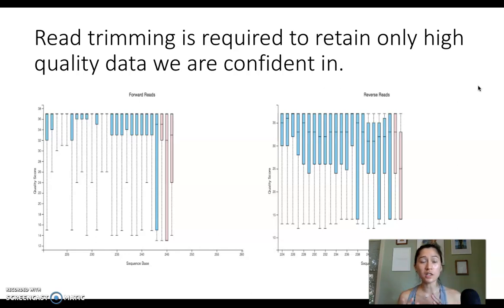When we are looking at our sequencing reads, at this point, we're using every single read we've obtained for our data analysis. But really what the quality plots are telling us is that even though the sequencer gave us nucleotides for every one of those 250 base pair positions, the nucleotides that it gave us at the end of the read, it's not very confident in. A lower quality score means we're less confident that the nucleotide that was assigned is actually the real nucleotide that was present in the sample. That's why we have to do this trimming step. We only want to use the high quality reads that we're confident in.